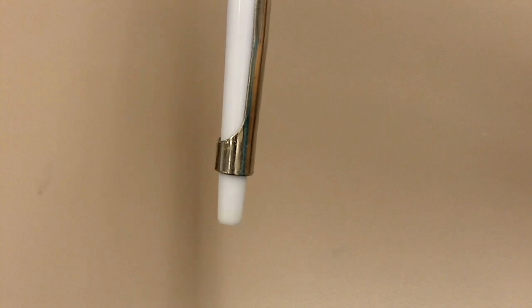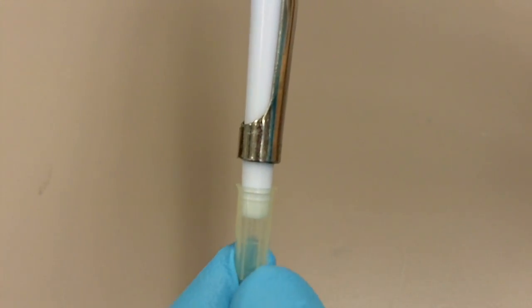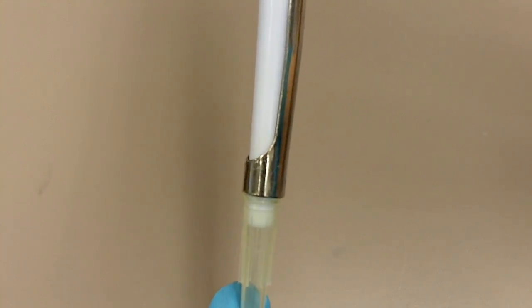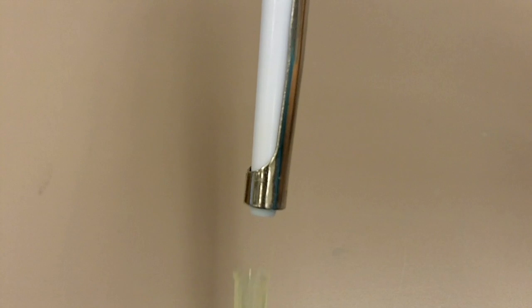So let's see what's happening at the end of the pipette. When you press down the ejector button, the ejector will move to the very end of the shaft, which will displace the tip like that. So if we put on the tip right now, when you press the ejector button, the ejector will move down and push off the tip.